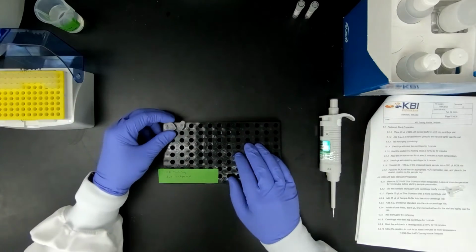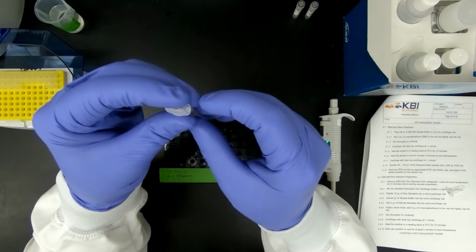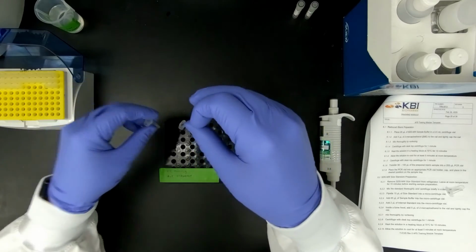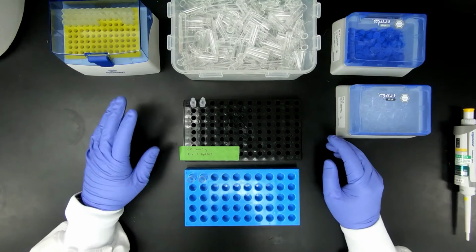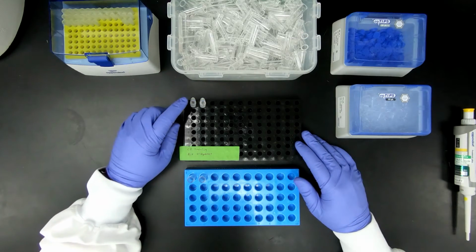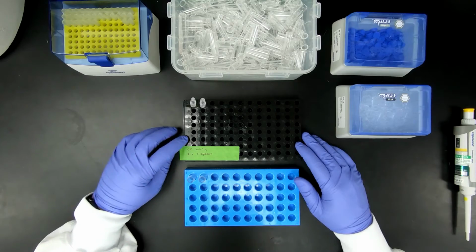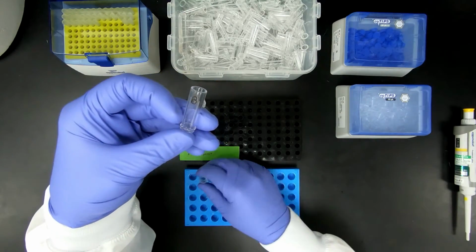Now that we've heated our samples, you will notice there's condensation at the top of each vial. So what I like to do is go ahead and tabletop centrifuge each one of these samples down. Now that we've spun our samples down after being heated, we can go ahead and let them cool for 5 minutes. After they've cooled, we can then transfer them into these vials for testing on the instrument.